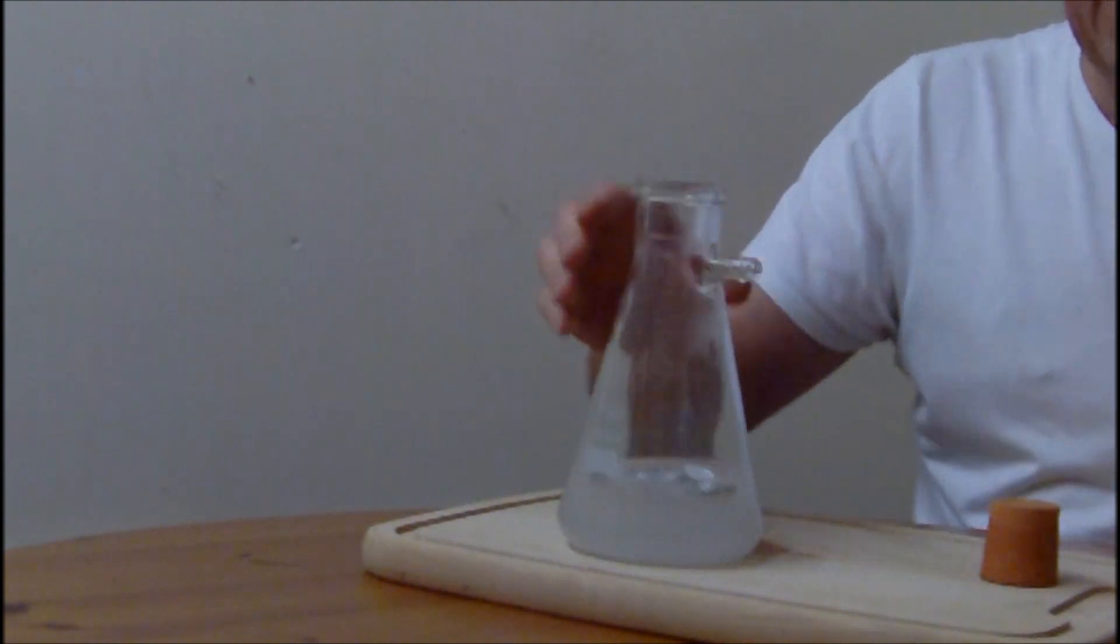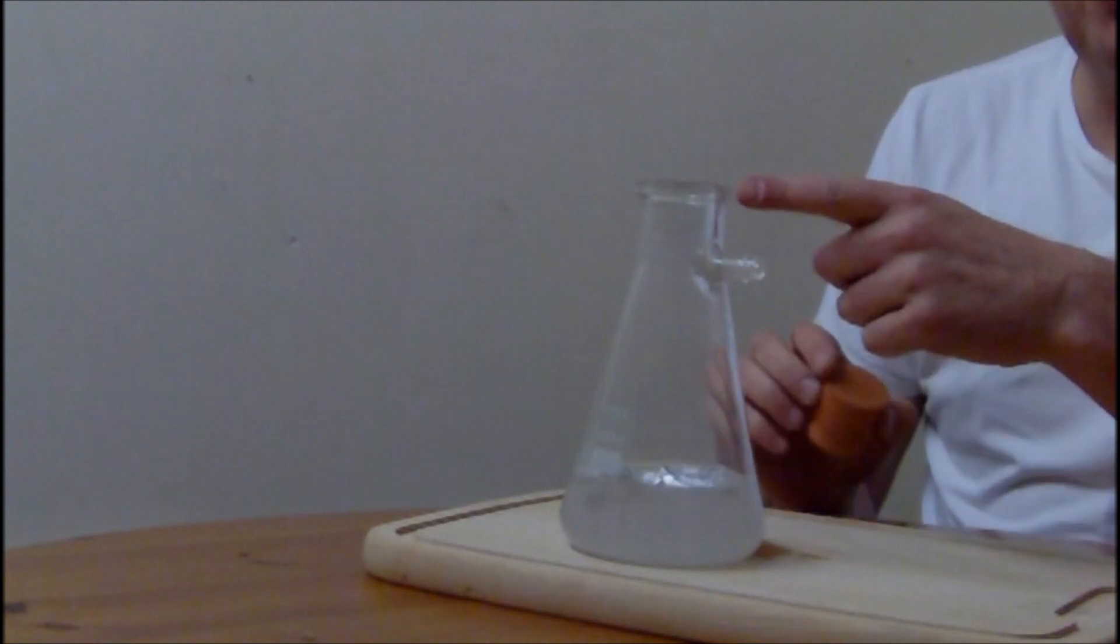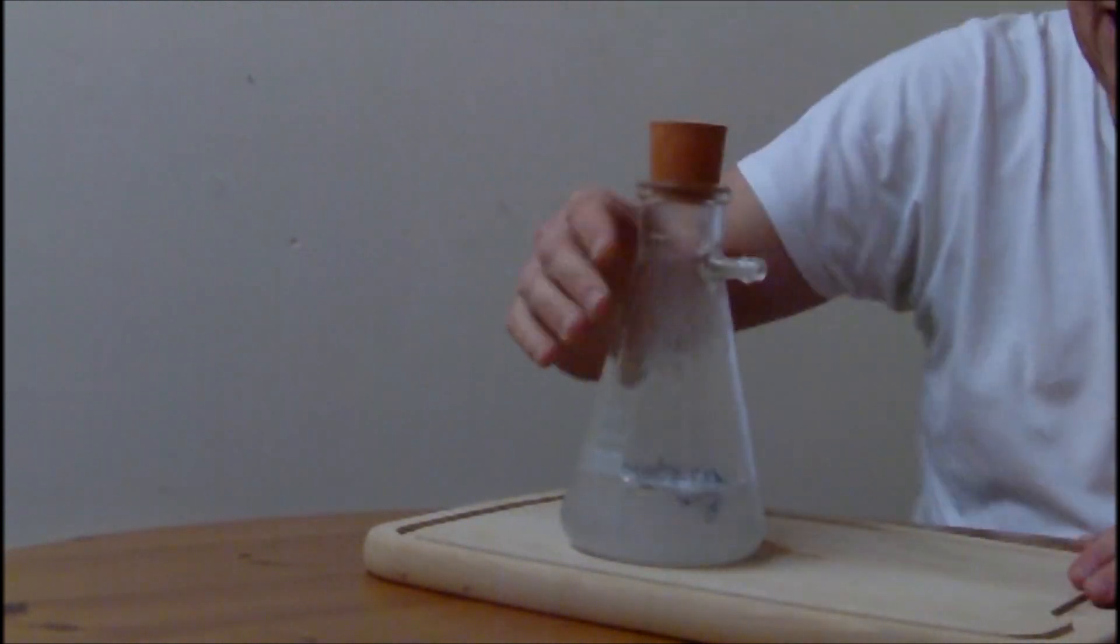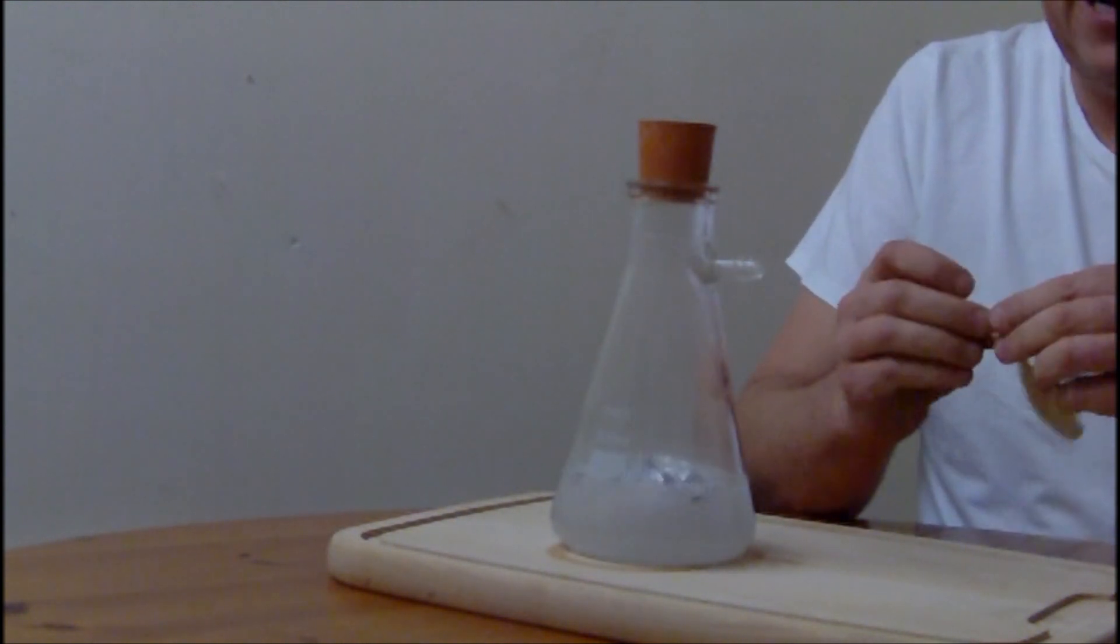Give it a bit of a swizz and straight away you can start to see it's producing a little bit of steam. This is the hydrogen gas. It's reacting beautifully and it's venting.